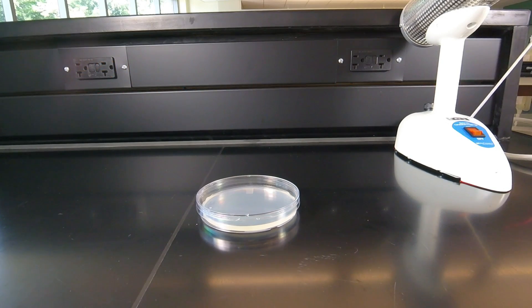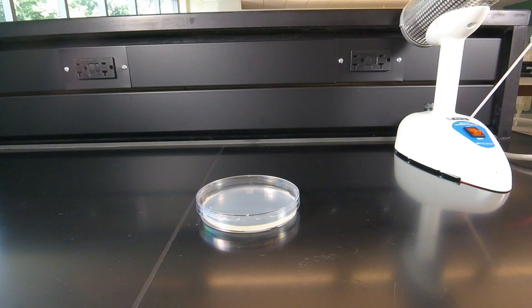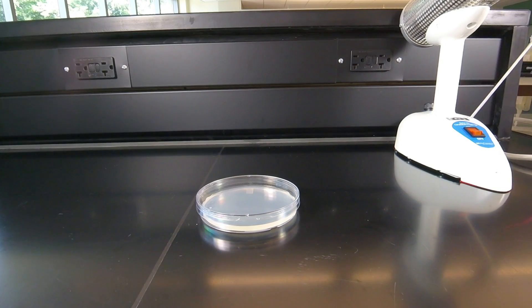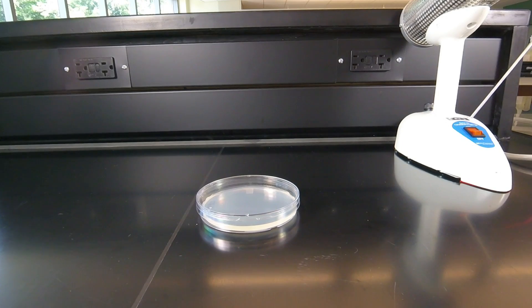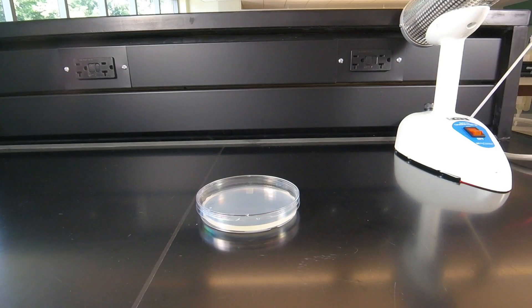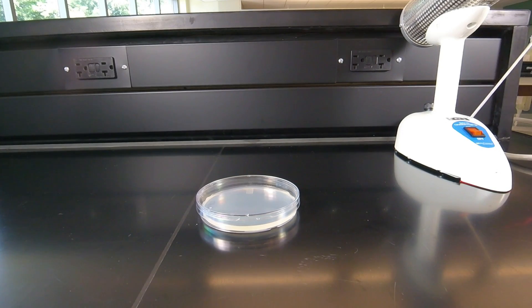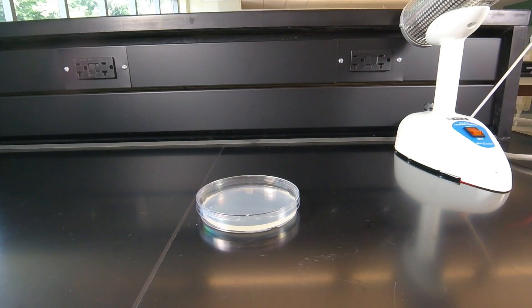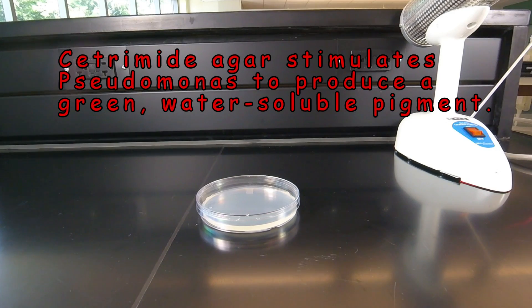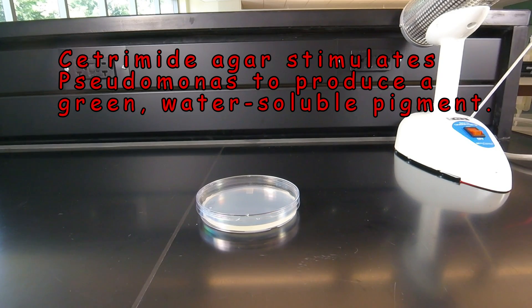In addition, the medium stimulates Pseudomonas to produce two water-soluble compounds: pyoverdin and pyocyanin. The pyoverdin produces a yellow-green or yellow-brown fluorescent pigment, while the pyocyanin appears as a blue water-soluble compound. When the two combine, we get the characteristic green water-soluble pigment characteristic of Pseudomonas.